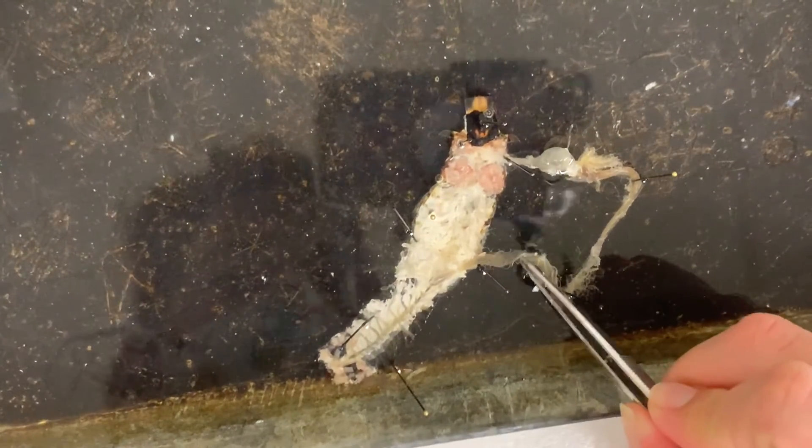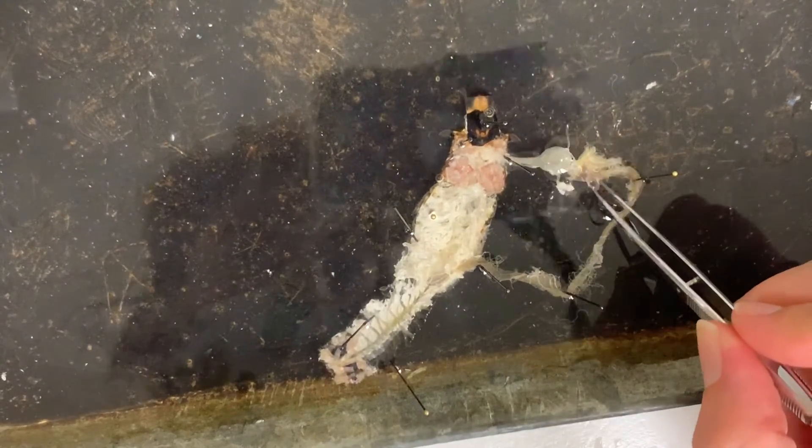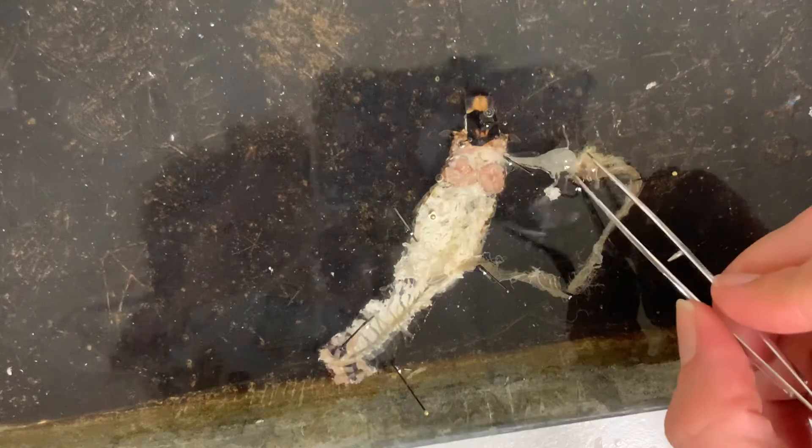You can see there's some darker bits and some purpley bits in the crop, which is nice — a little funny shape.